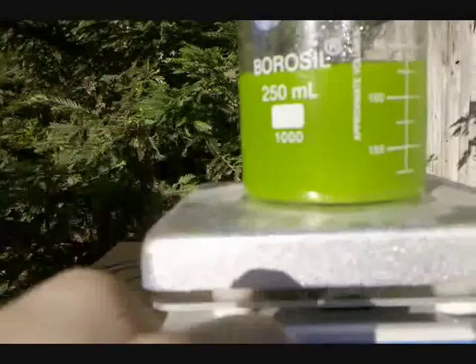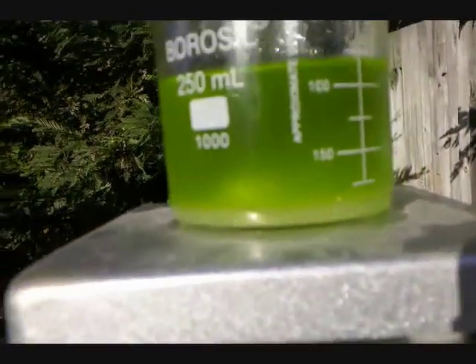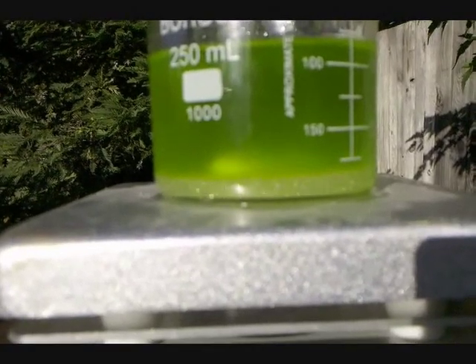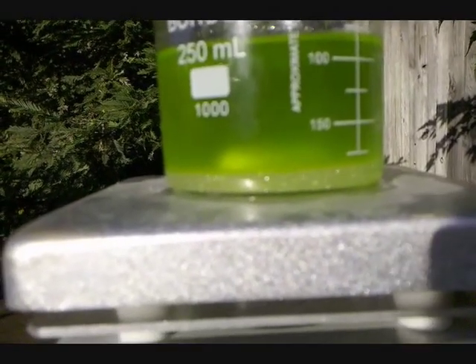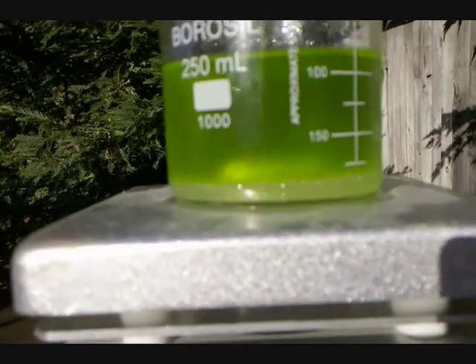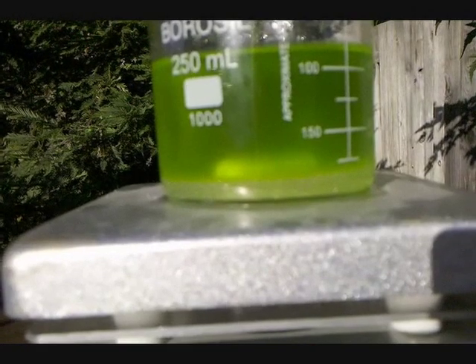It's been running for a couple minutes now. I'm going to turn the stirring off — I don't know how well you can see on camera, but you can quickly see a layer of the solvent and tiny beads settling to the bottom. In a few minutes they'll all join together and form the layer that I will extract. If you have a sep funnel it will make it a lot easier — I'm just going to be drawing it off with a pipette.